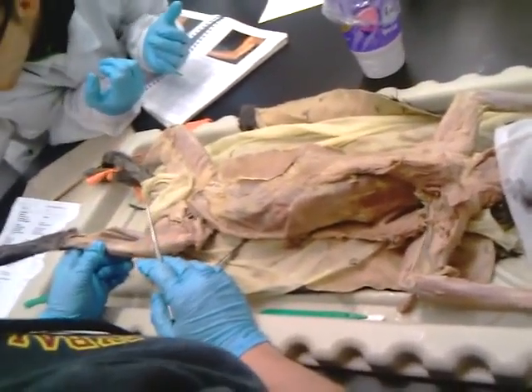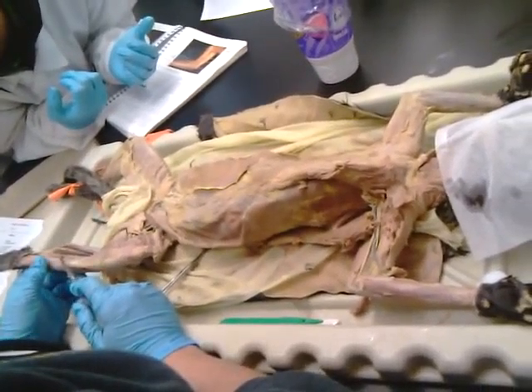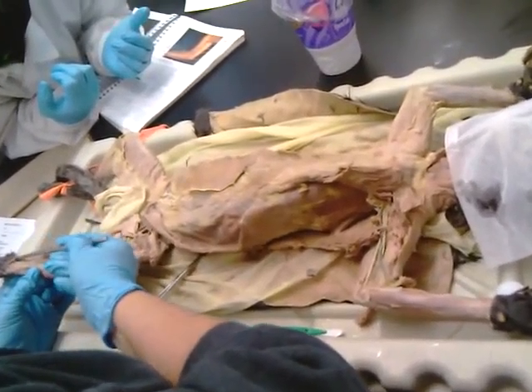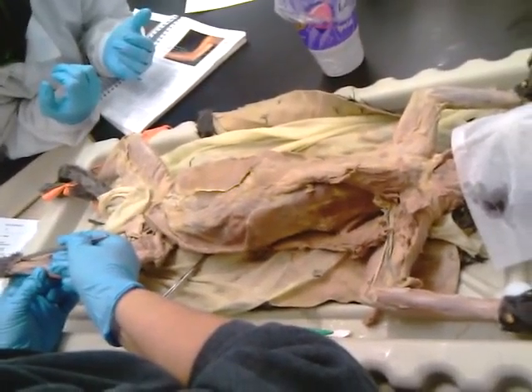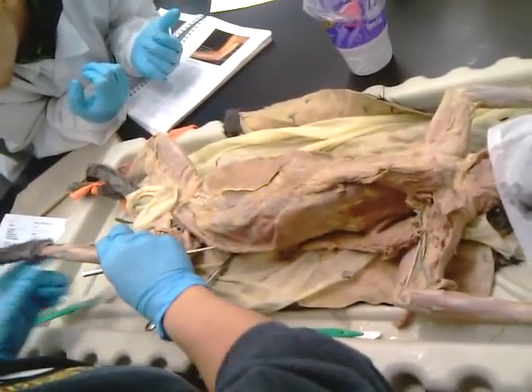So let's figure this out. Okay, again, if you're in this dilemma, I have a little pin in there, so name this muscle. Follow it along. It's going behind the ankle, and it's going to go into the foot. Flexor. So it's going to be a flexor.